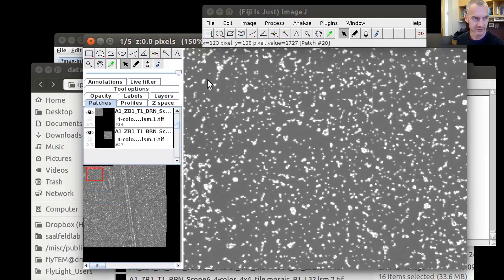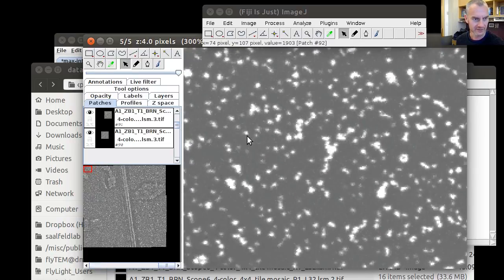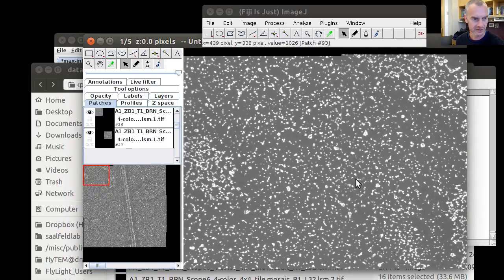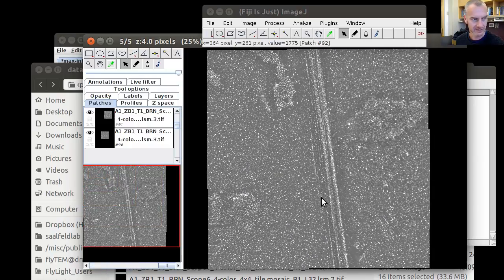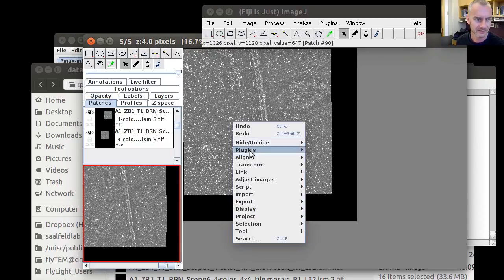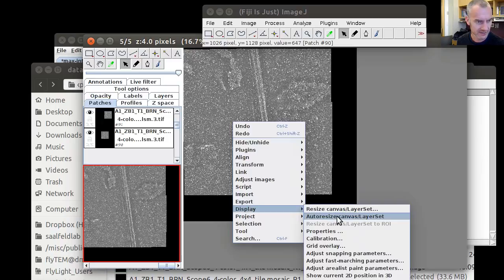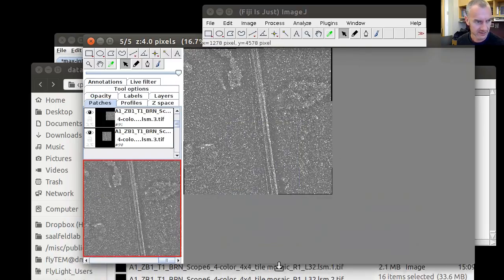The channels should be approximately aligned. What we still see is that there are obviously differences across channels that couldn't be compensated for. And this is what we're hoping to compensate now. So the first element to fix is the nonlinear component of the lens distortion. And before we do this, we adjust the size of the canvas. Auto resize canvas layer set.